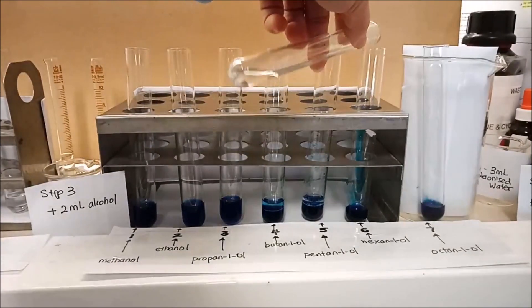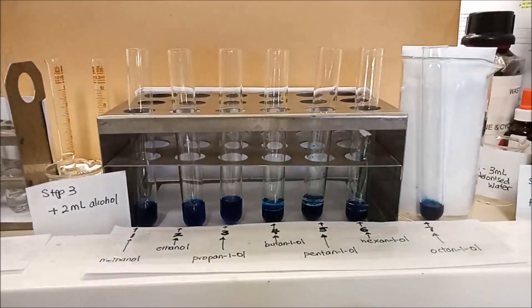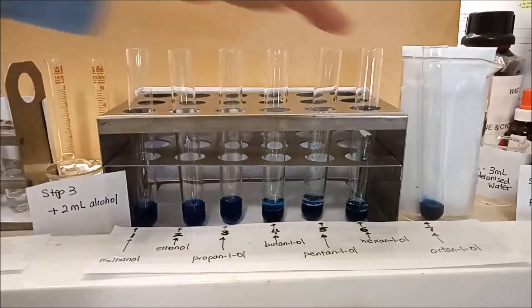Let's look at the sixth carbon chain. Two mils of hexanol to three mils of water. And let's see what happens to it.